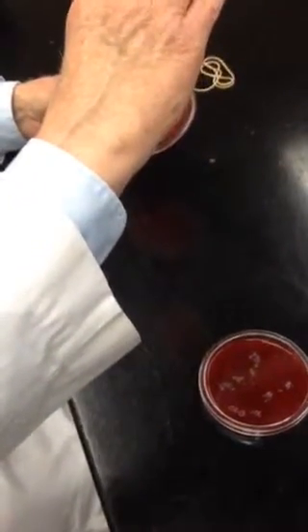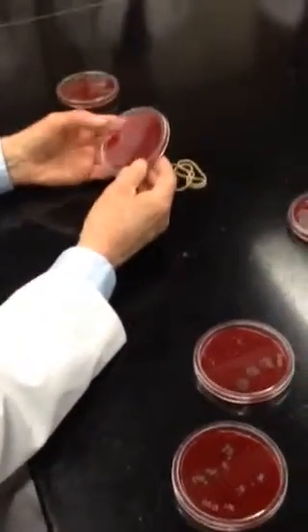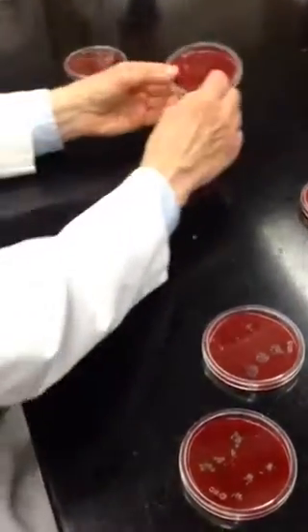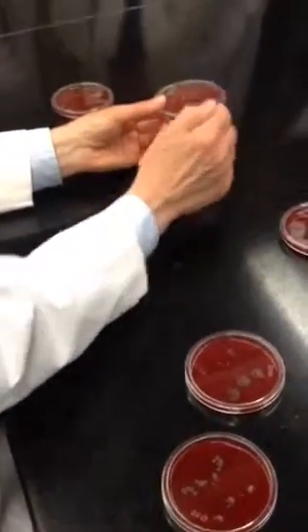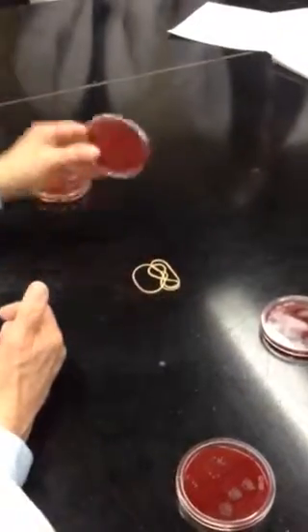Shake dry hands, and I shook off my hands after I washed. Okay, so this basically is dry hands and wet again. And again, this thing split because it dried. It got dehydrated in the incubator. Notice less microbes on the dry, more after rinsing and shaking off. So confirms this result.